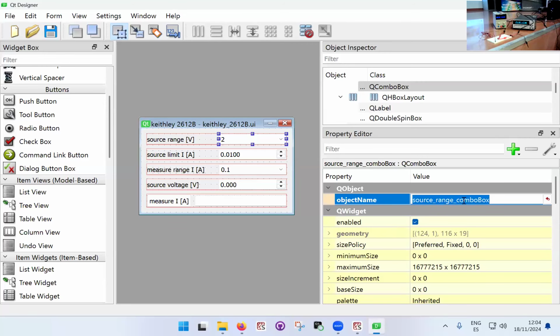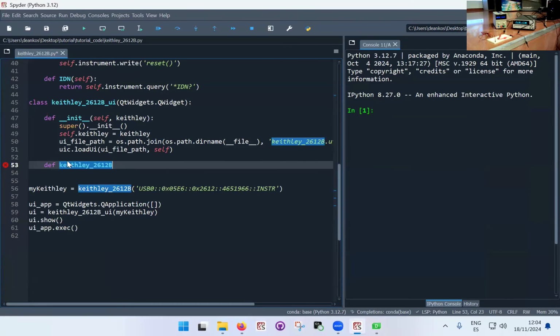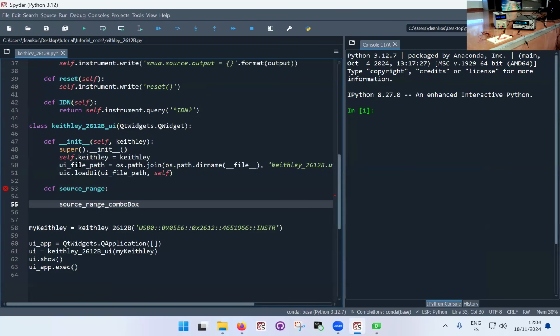That didn't copy properly. I don't know why the Control-C is not working. Maybe it's assigned to something different. So I'm going to define. This works well. So now I'm going to remove this because I'm going to need that a little bit later. I'm just going to paste it here to have it to use in a minute.